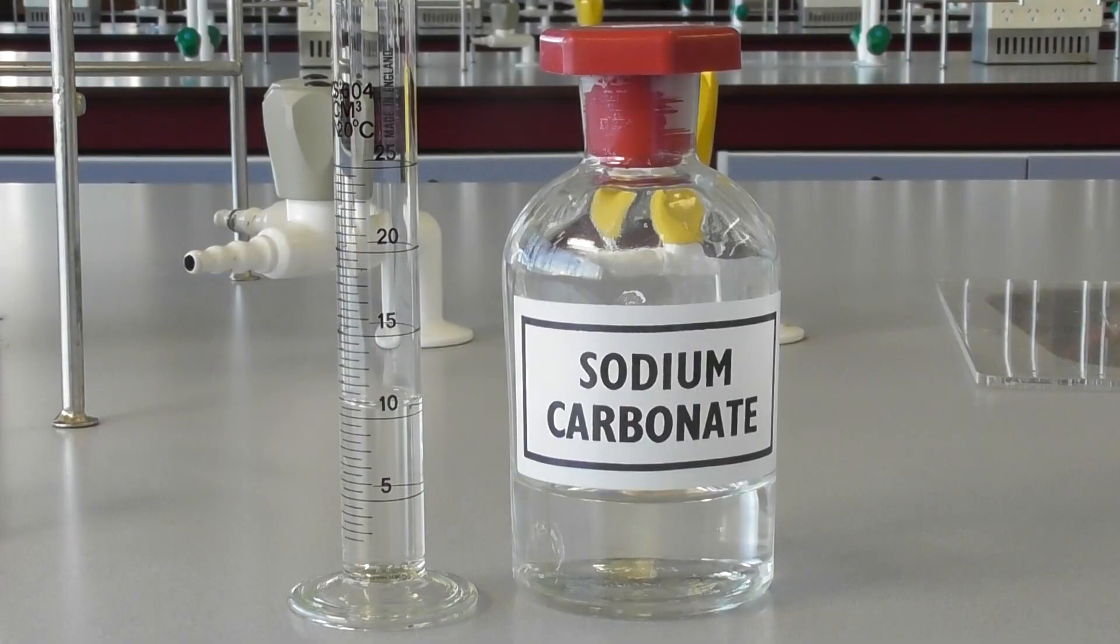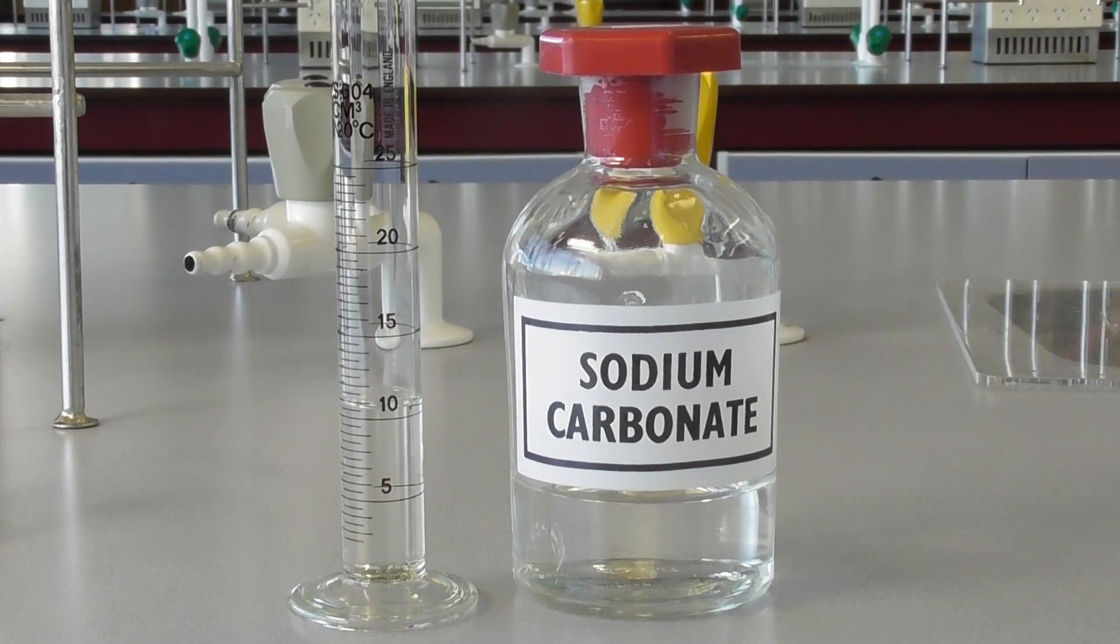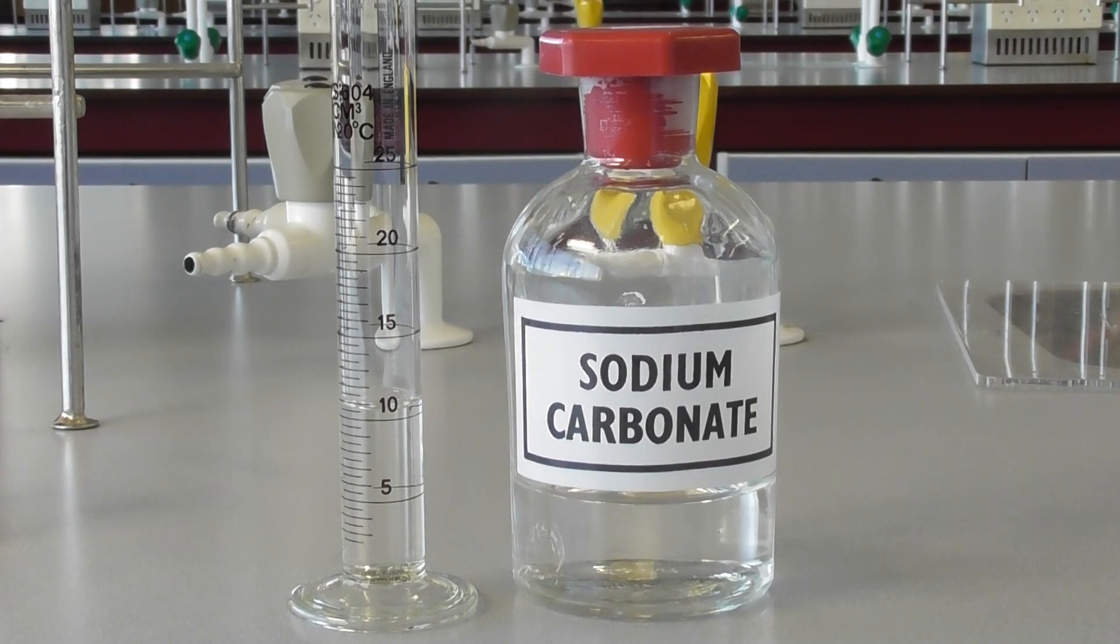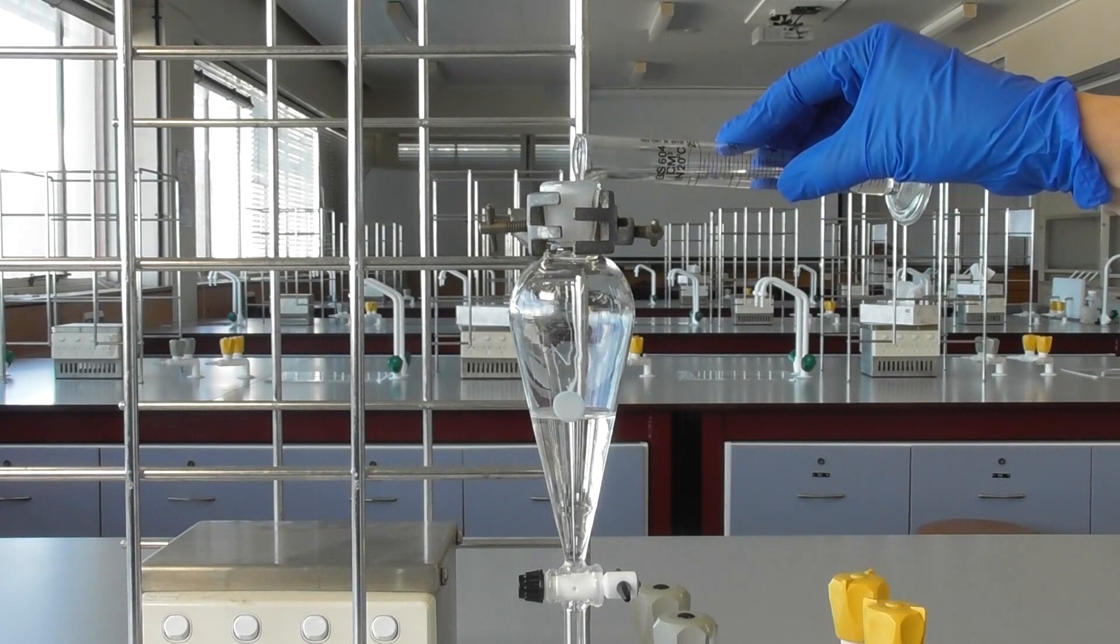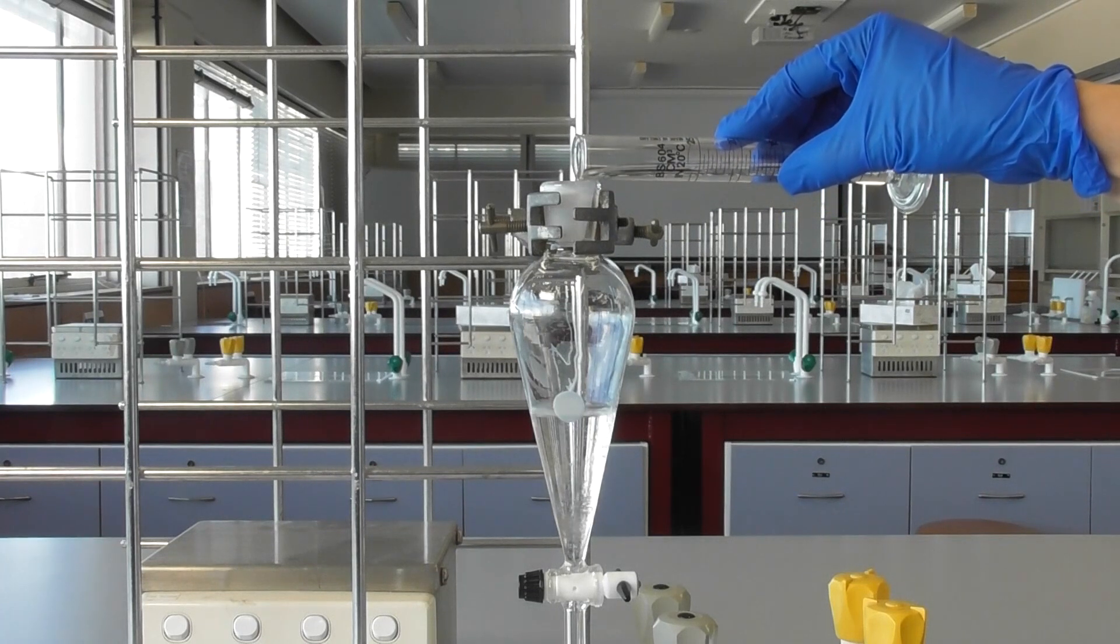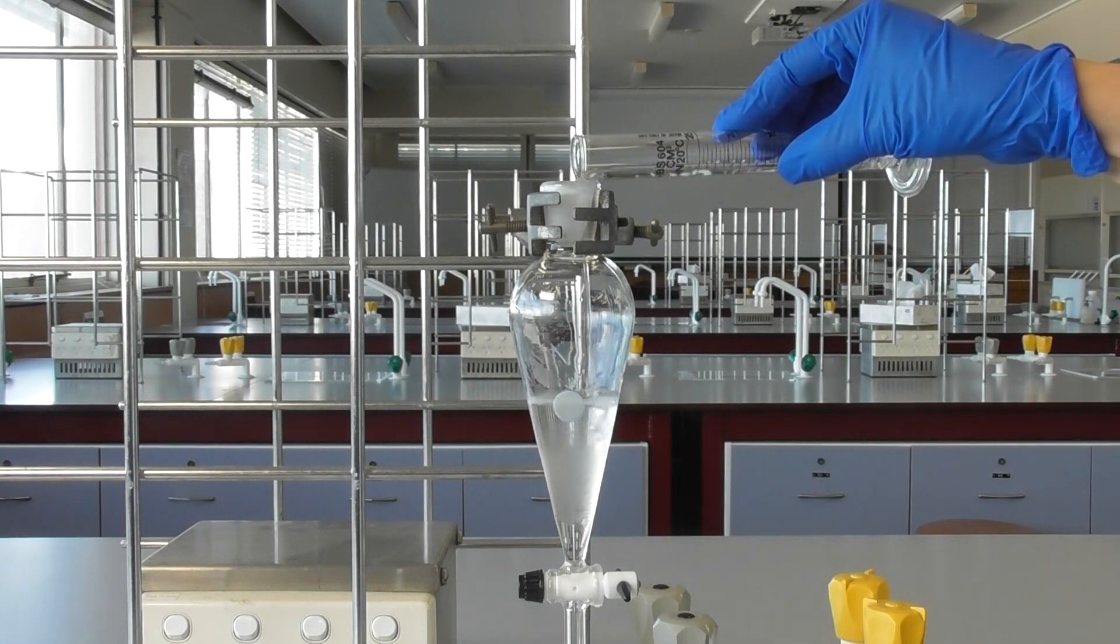A common washing procedure uses a solution of sodium carbonate, which neutralizes any acids present. Measure and carefully pour the sodium carbonate into the separating funnel.